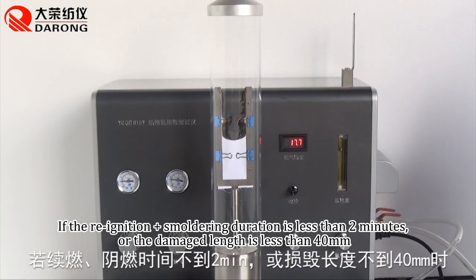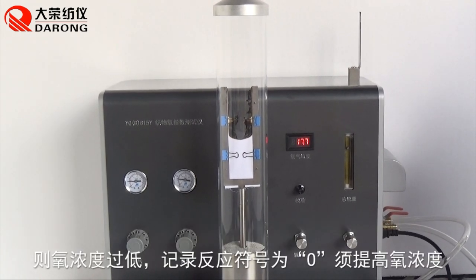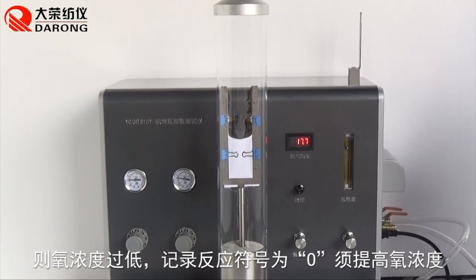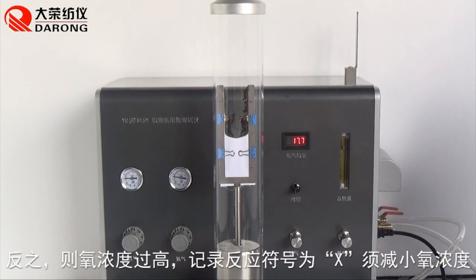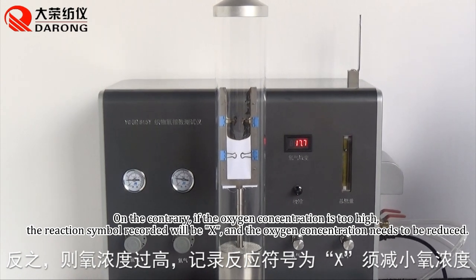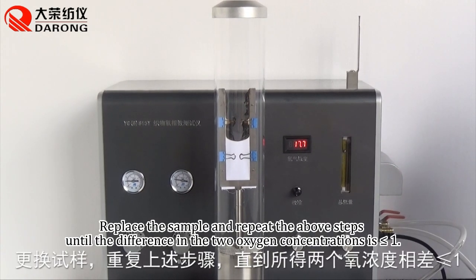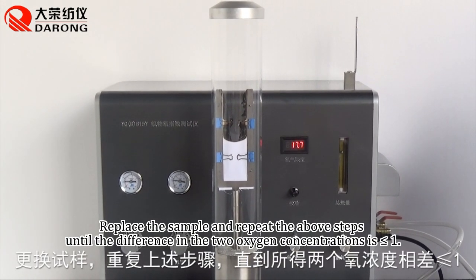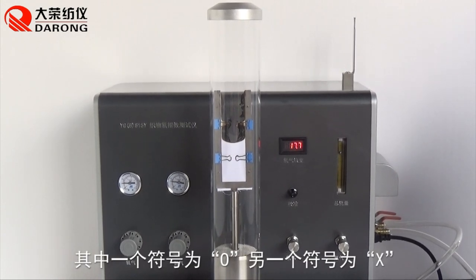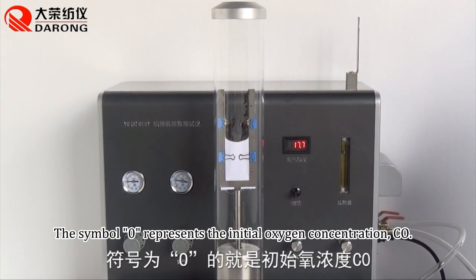If the reignition plus smoldering duration is less than 2 minutes, or the damage length is less than 40 millimeters, the oxygen concentration is too low, the reaction symbol recorded will be O, and the oxygen concentration needs to be increased. On the contrary, if the oxygen concentration is too high, the reaction symbol recorded will be X, and the oxygen concentration needs to be reduced. Replace the sample and repeat the above steps until the difference in the two oxygen concentrations is less than or equal to 1.